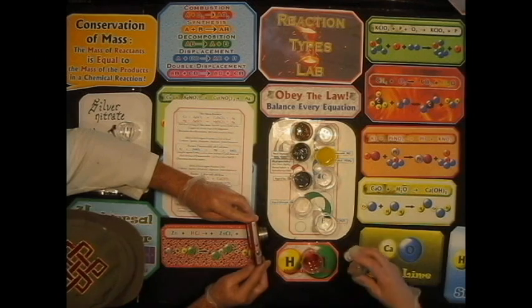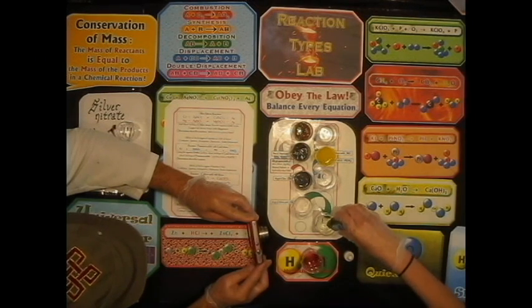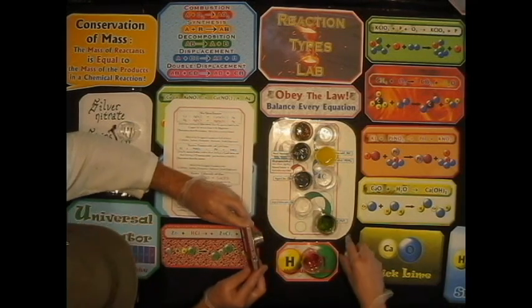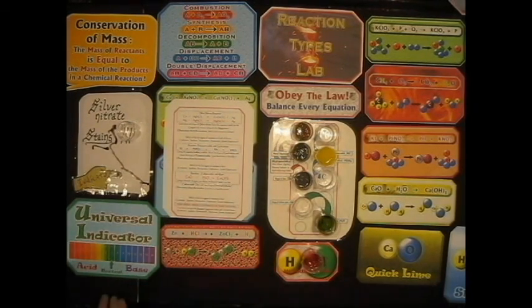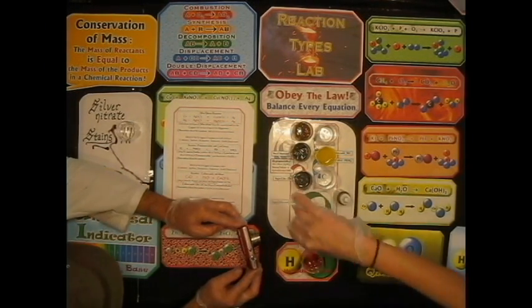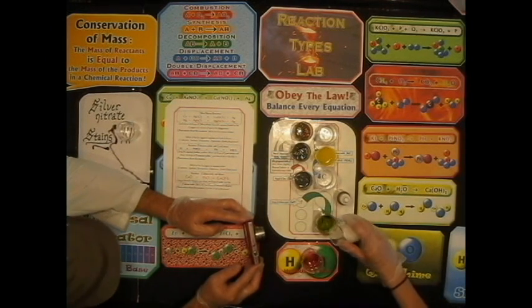This should not change its temperature. Okay, that's a nice color. Now, is that what you expected? Kinda, yeah. What does green indicate? Green indicates neutral. Like water is neither really an acid or a base. Well, actually, it's both, but one or the other at a time. Okay, so now you're going to dump the powder in there. The calcium oxide is going in.